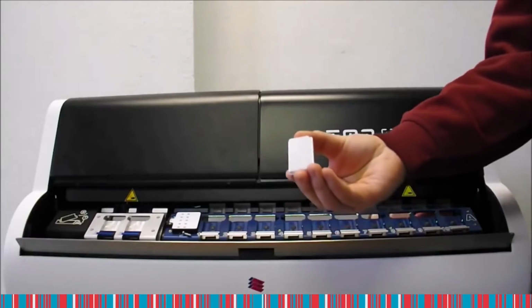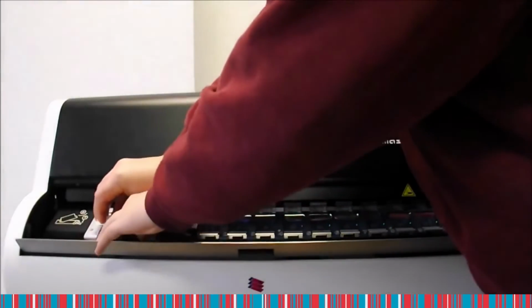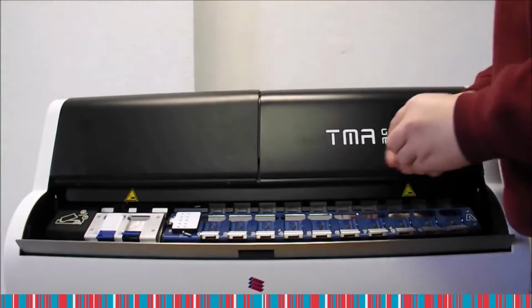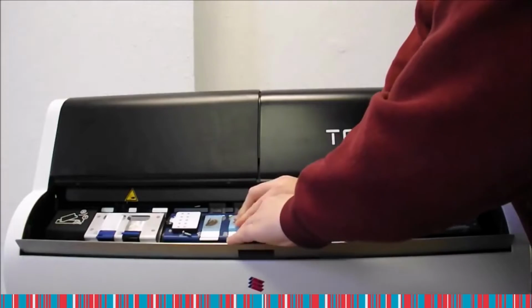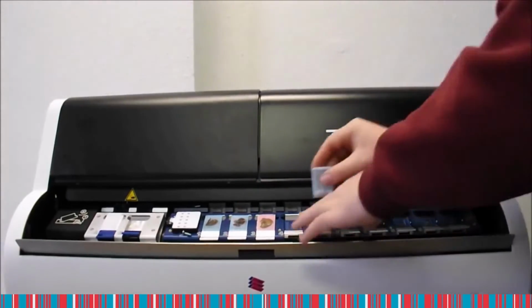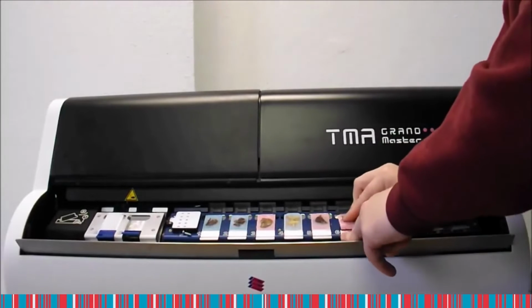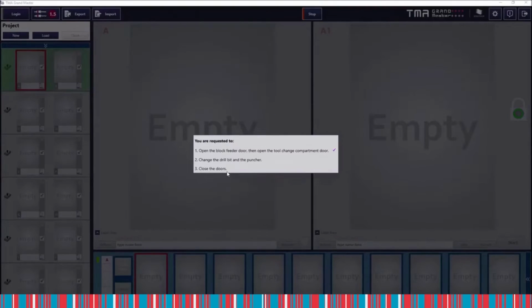At this step, you can save some time if you insert some recipient blocks and also some donor blocks in the machine. This is useful because since the block feeder door was open, the TMA Grand Master will check the first trays which were in the door position automatically. If you filled all the blocks you need, just close the door.